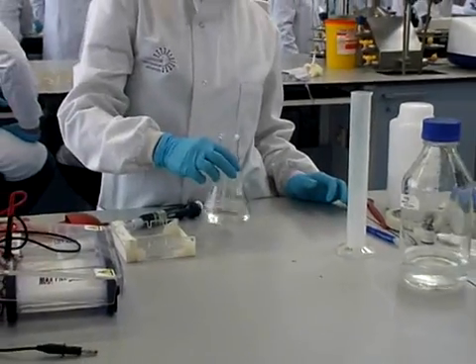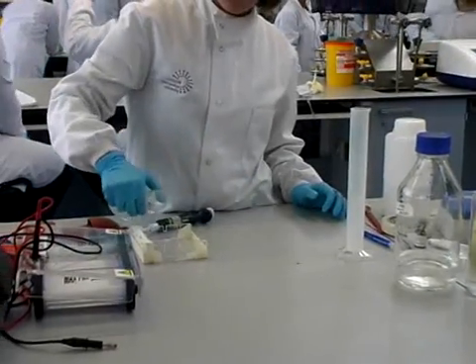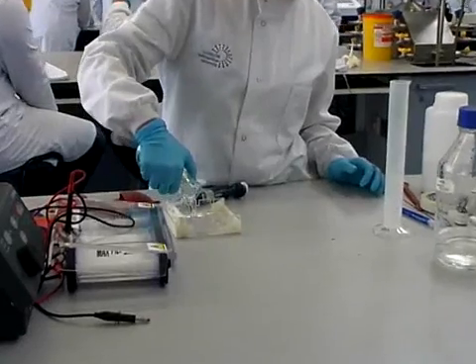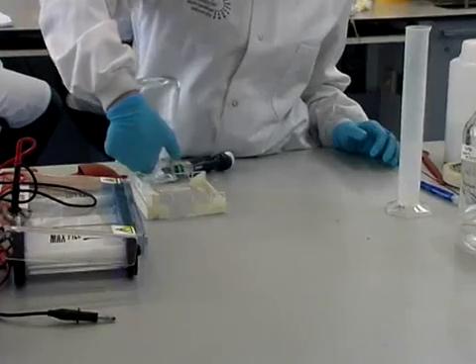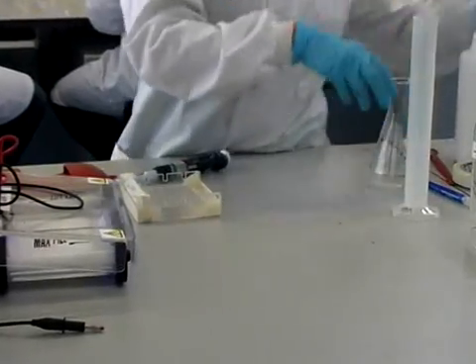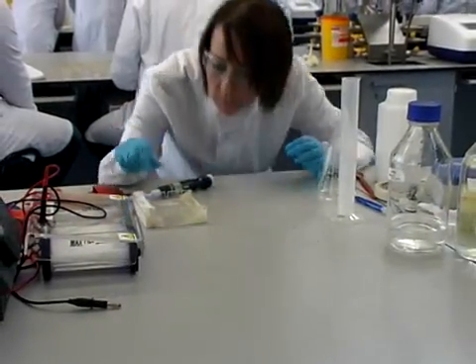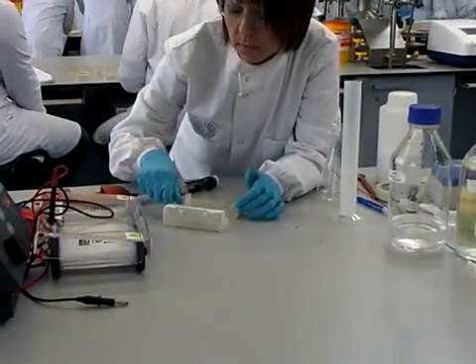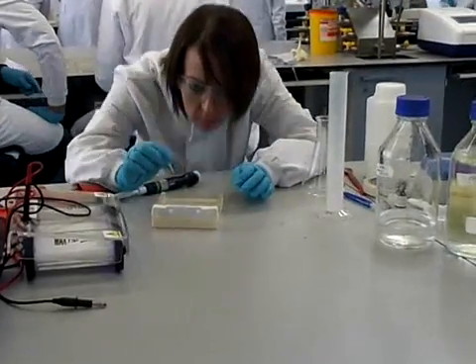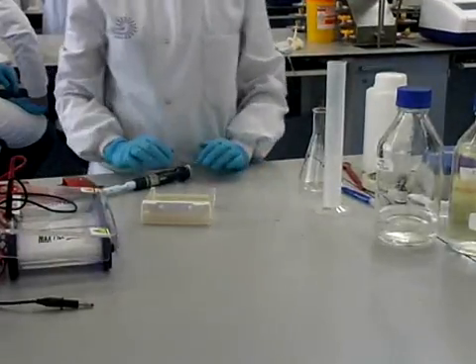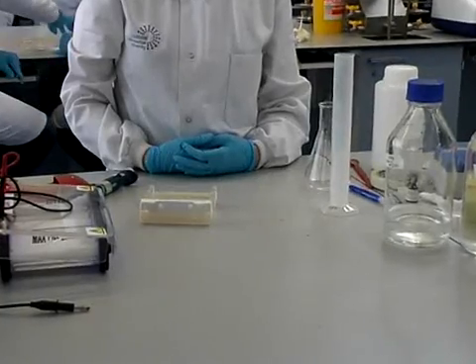The Ethidium Bromide is well mixed into the gel and the gel is poured into the gel preparer. You then ensure there are no bubbles present on the surface of the gel. You can use a pipette tip to get rid of any bubbles. Now we wait until the gel sets and then it will be ready for us to add our samples.